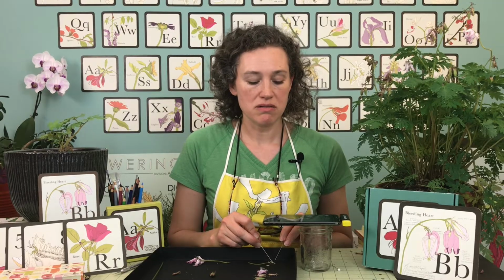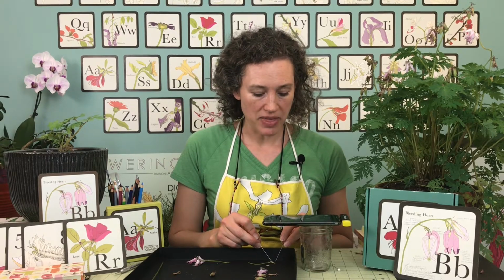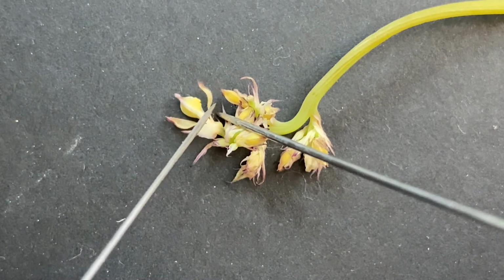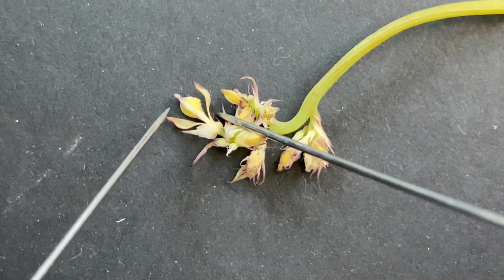So we know that petals only come in groups of 3, 4, or 5. Since there are 2 here, we know that something had to get fused. So what I'm thinking is there are 2 fused petals on this side and 2 fused petals on this side. This is a eudicot, and eudicots like to make petals in groups of 4 or 5. And then this part that's in the center is the corolla.